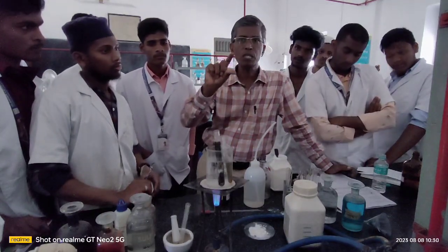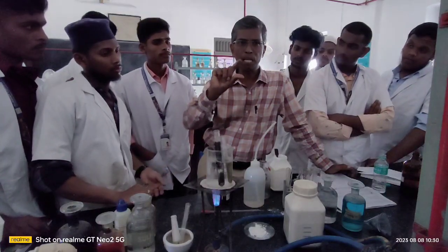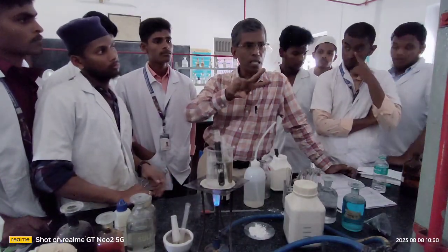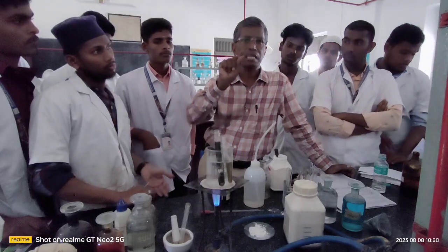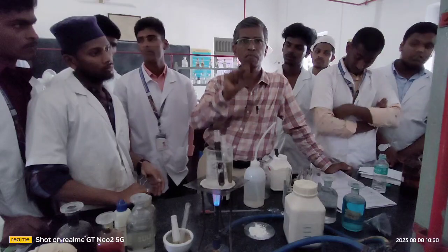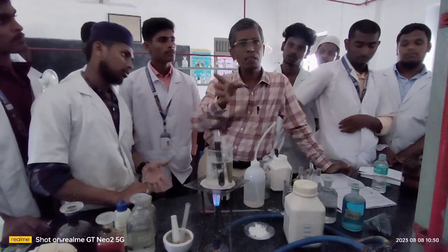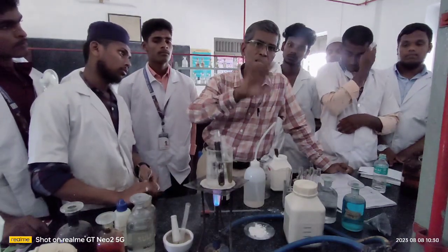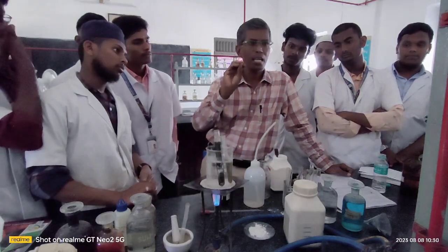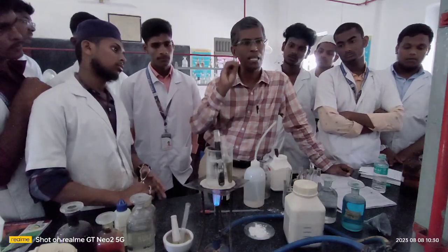If you get a pink colored solution after shaking the organic compound with the Schiff reagent, that confirms the presence of aldehyde. Remember, this Schiff reagent test will not respond to carbohydrate. In that way, you can differentiate the carbohydrate from your aromatic aldehyde, right? So I have explained to you very clearly the very important, crucial steps in your organic compound analysis.